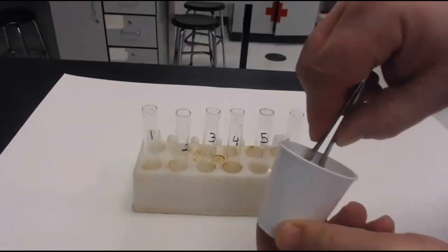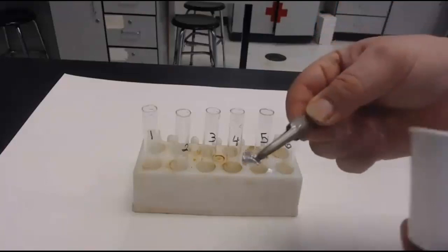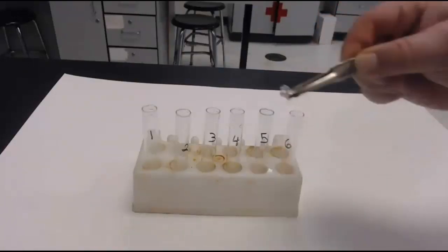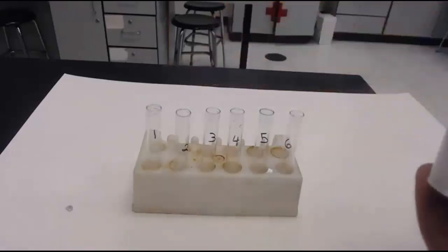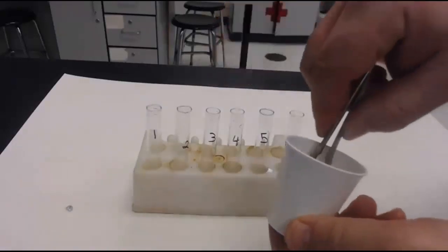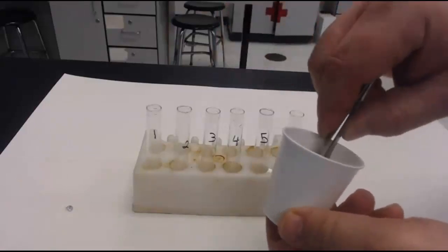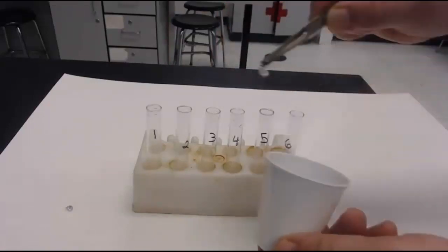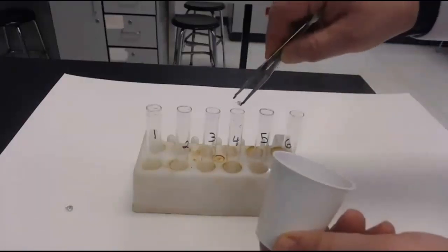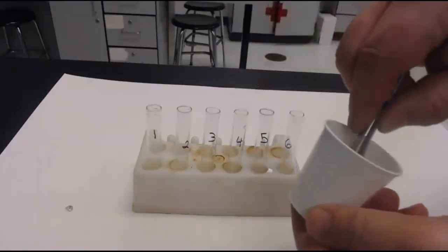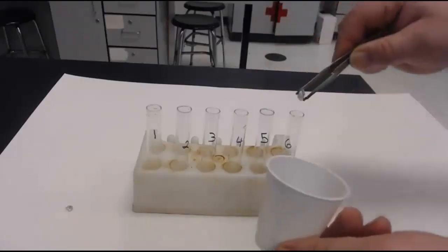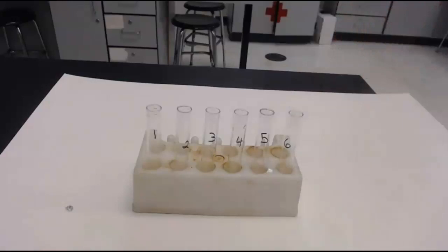Now, we're adding our unknown. See it? Shiny, silvery metal, just like practically every other metal on the periodic table. We'll put a little bit in there, and of course, we'll spill some off to the side. We'll put some in there. Get that piece. There we go. Put some in there. It's a nice, visible-sized piece. It's kind of a little one there, but that's good. And we'll put a big old piece in there, and one more piece in there.